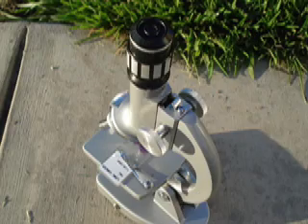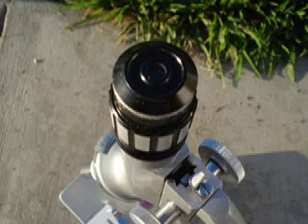Now let's take a closer look at a microscope image. When you first look into the eyepiece, your image will probably appear blurry. If you slowly turn the coarse adjustment knob, your image will come into focus.